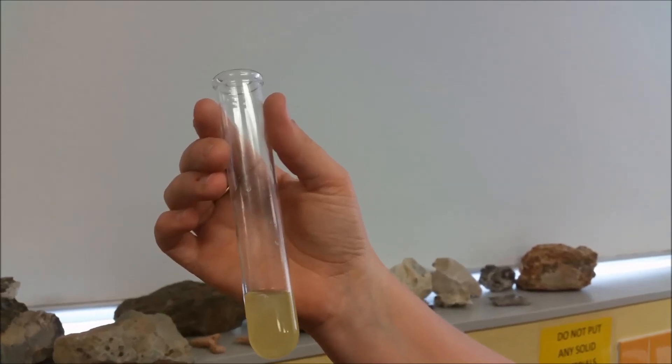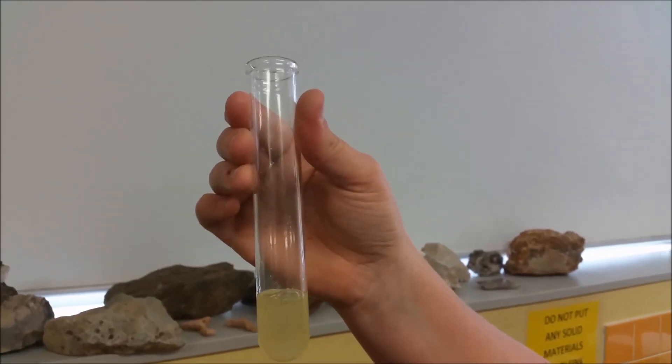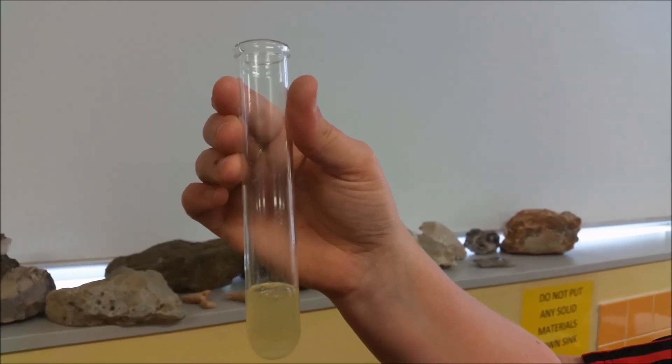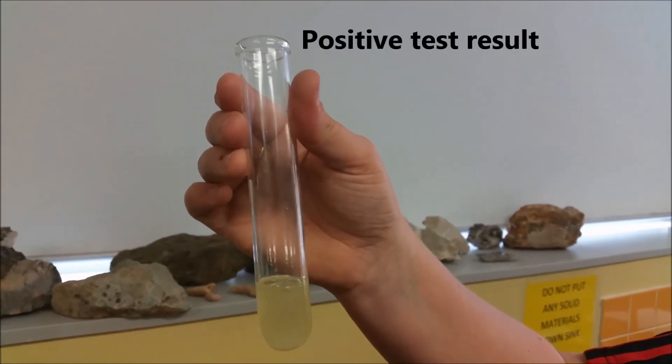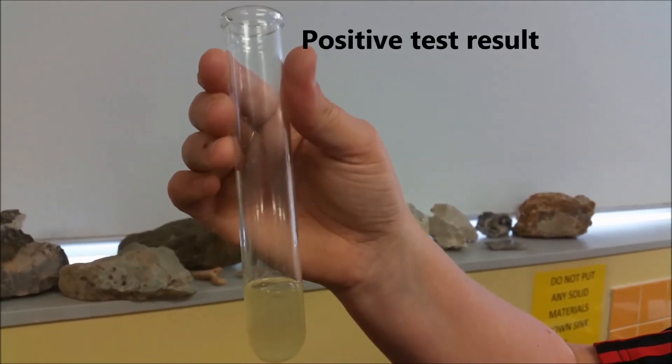As I did with the other ones, I've put protein solution inside the test tube to get our positive test result, to know if protein was present and what would actually occur.